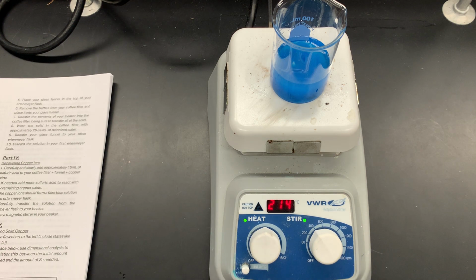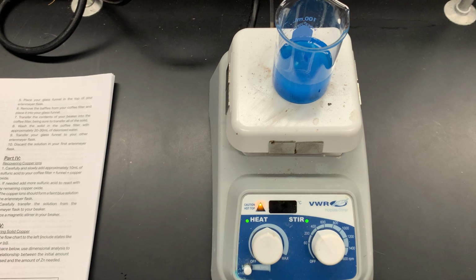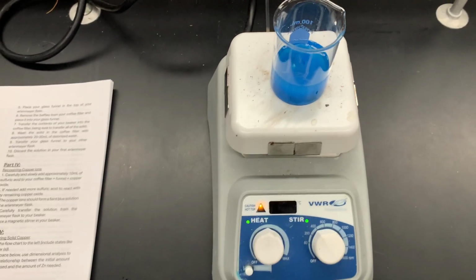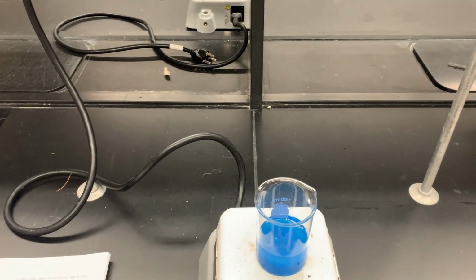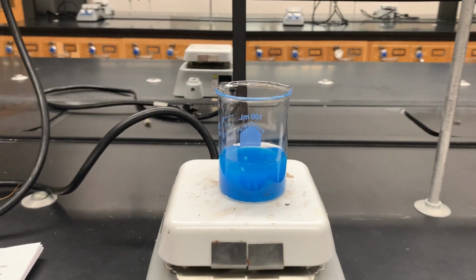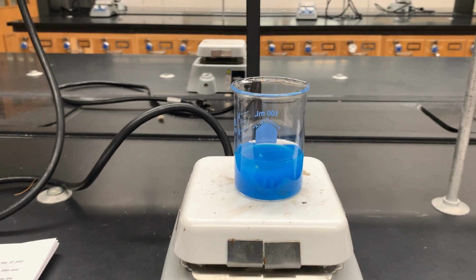What's very important when you're heating something is that you're keeping an eye on it, you're observing it, and seeing anything change about it, because what's going to happen to this is this solution will begin to boil. Now, what I'd like to draw your attention to is basically the side appearance of it, because that's what we want to see. We want to see what happens to this copper hydroxide as it gets heated.